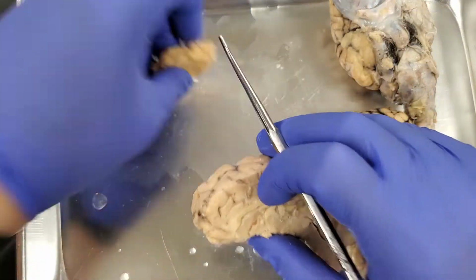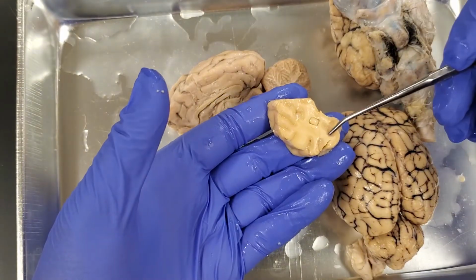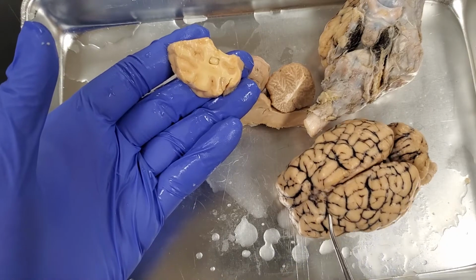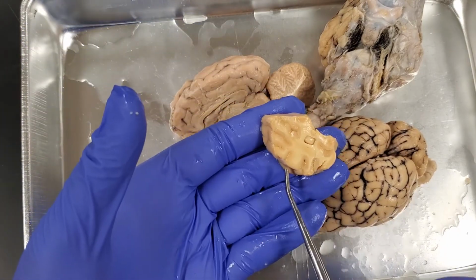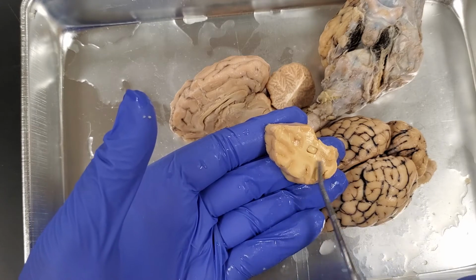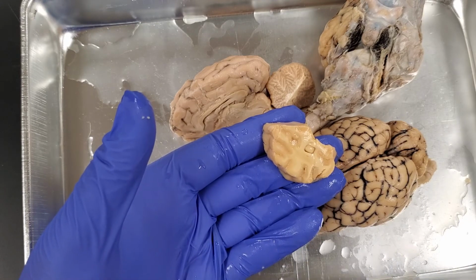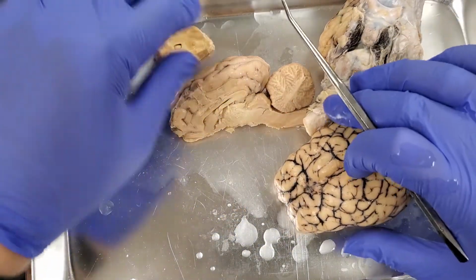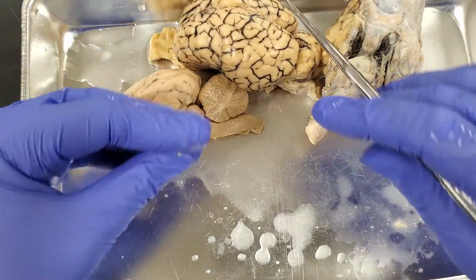The other thing that I have here is a slice of the brain. What I did was I took one of these brains and sliced it this way. That way you can see that the gray matter, once again, is superficial in the brain, while the white matter is deep. Once again, white matter is made out of axons sending information. Gray matter is superficial, and it is basically processing information.